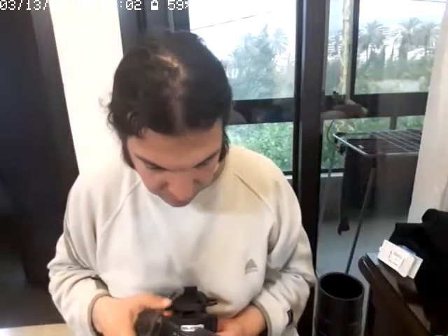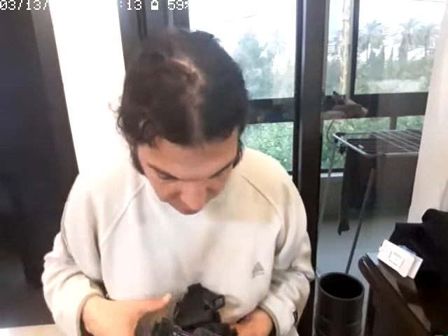Telescope filters do sit underneath here, and they have screws. And you can't swap between color filters, just for fun. So we have to use this because it's smaller.